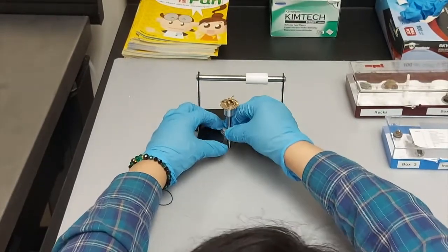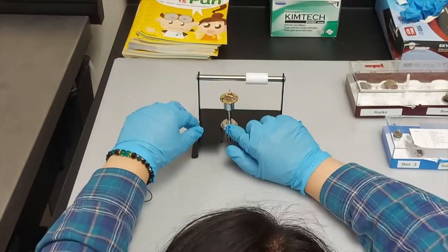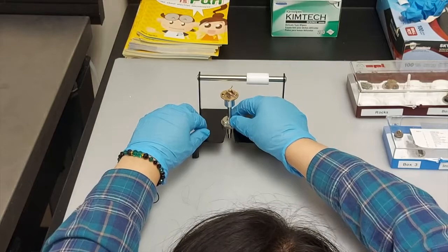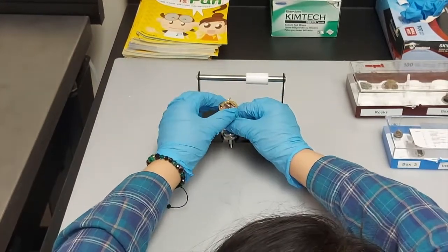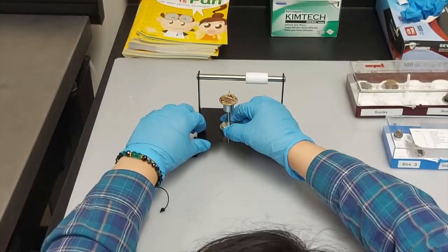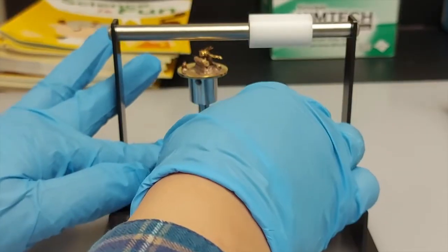For reference, refer back to the beginning of this video when lock nut 1 and lock nut 2 are shown. Ensure all the components of the sample holder are secured but not too tight.